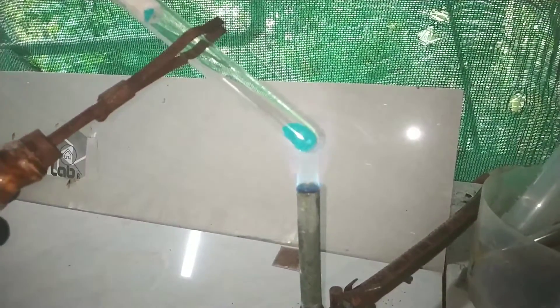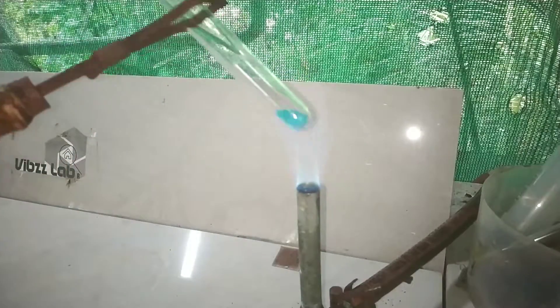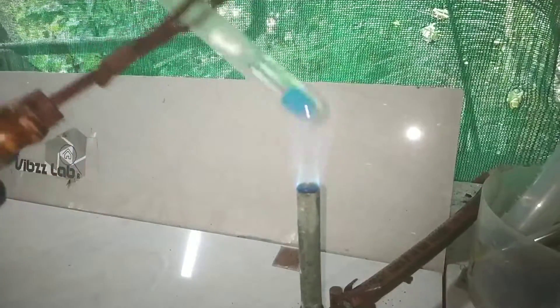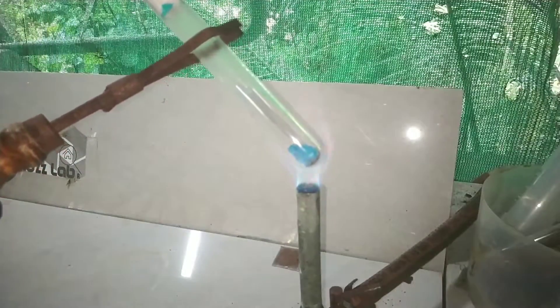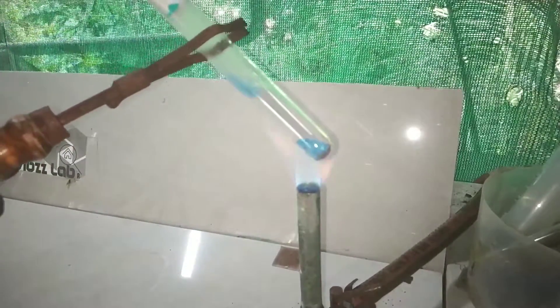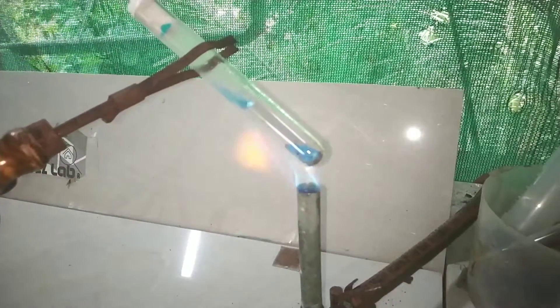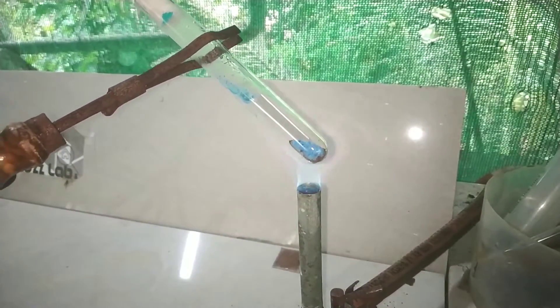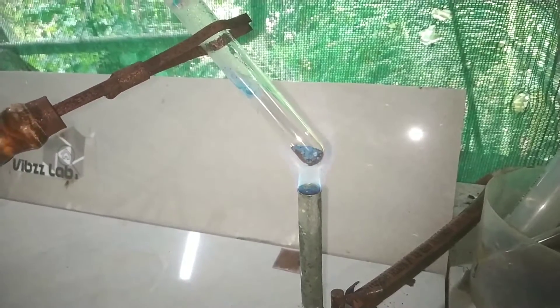You initially notice the color change from green to blue. The blue color is actually the anhydrous form of the copper 2 citrate. Further heating will produce a brown to black color, and we should continue heating for a few minutes after this color has been produced to ensure complete reaction.